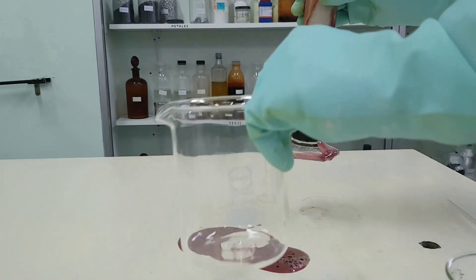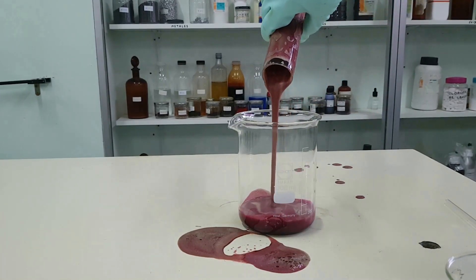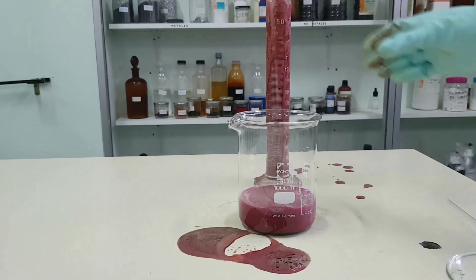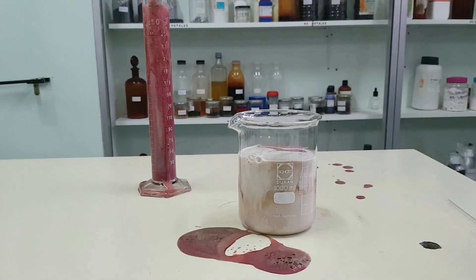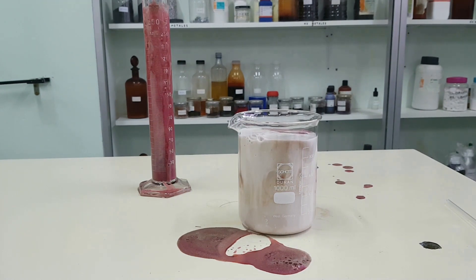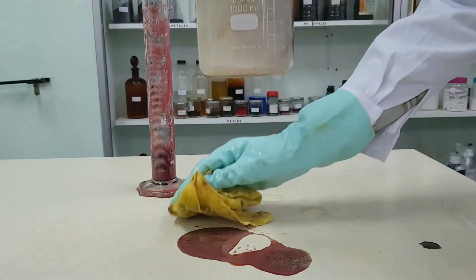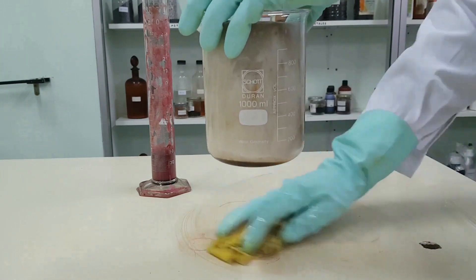Do it now in a beaker. Add more oxygenated water. The purple potassium permanganate is not evenly distributed throughout the foam.